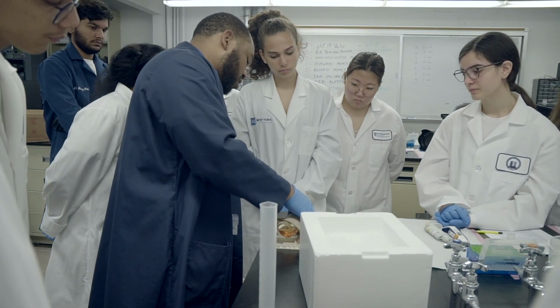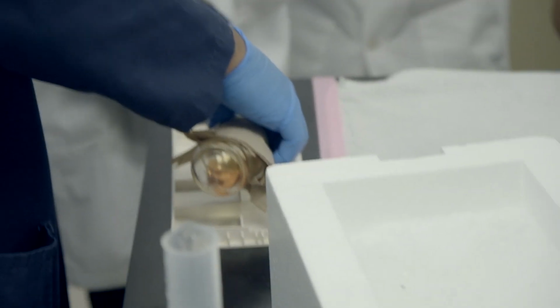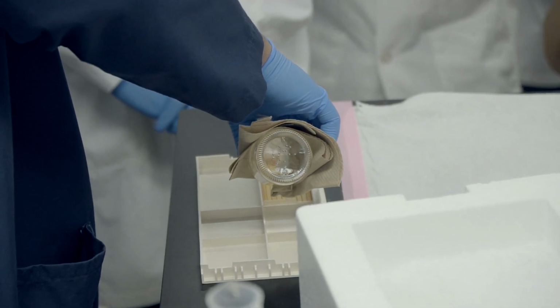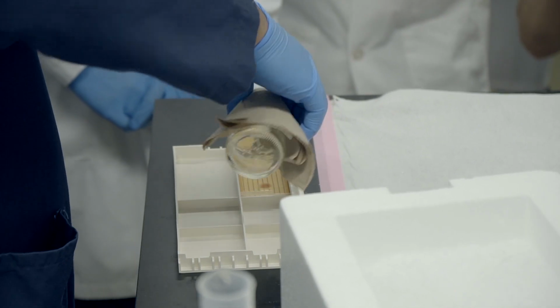I'm going to use one location. I find pouring into a corner and letting it flow reduces things like blurry lines and other things you don't want in your gel later. So just pick one spot, usually a corner, and pour it all the way in.